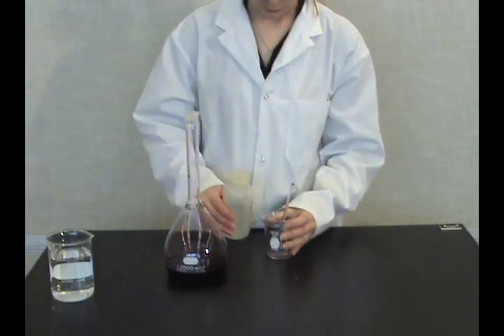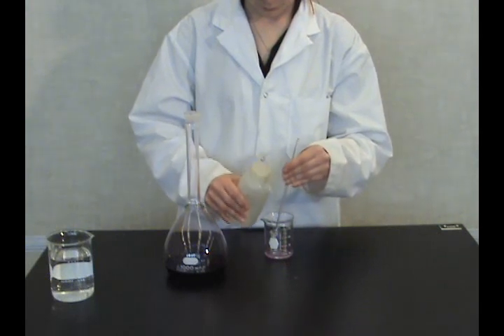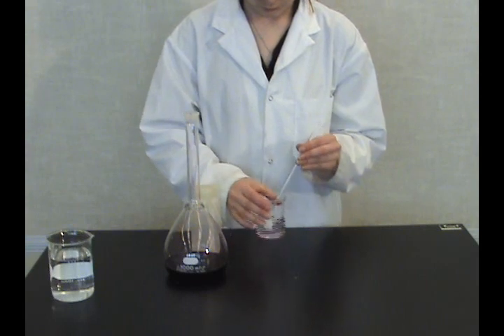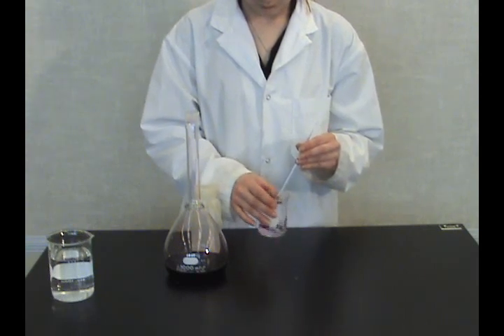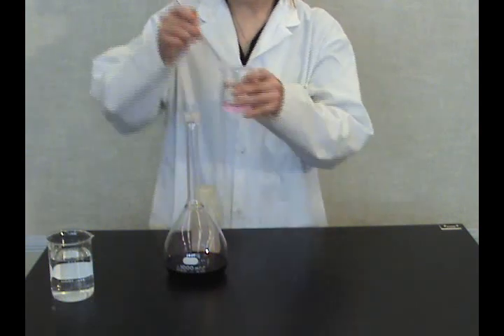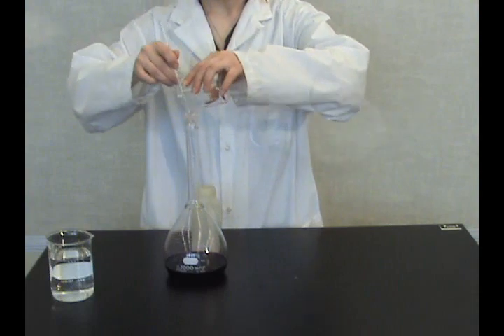Make sure that the stirring rod and funnel, if used, are rinsed as well. Add all washes to the flask.